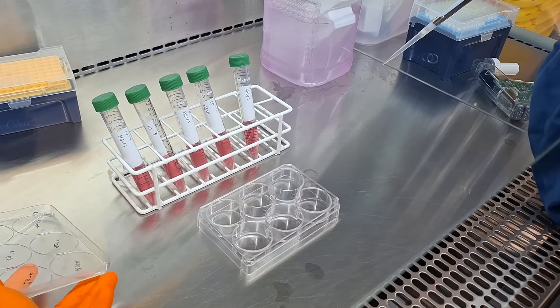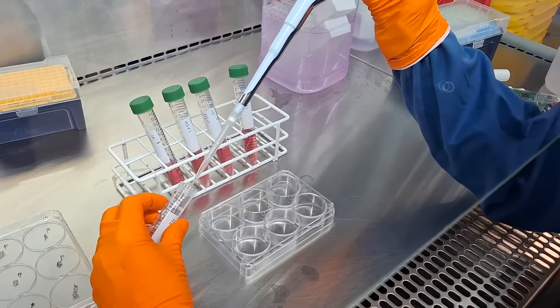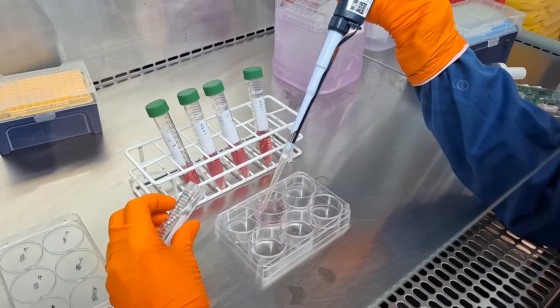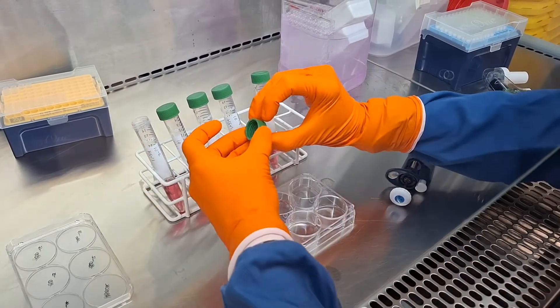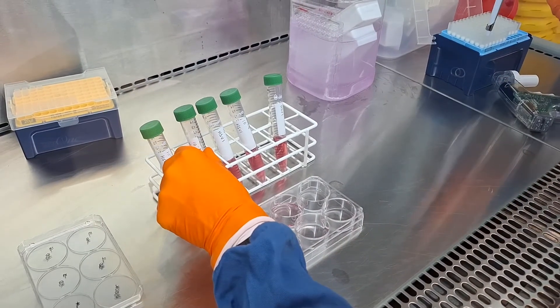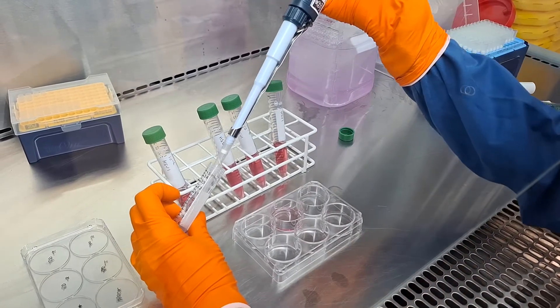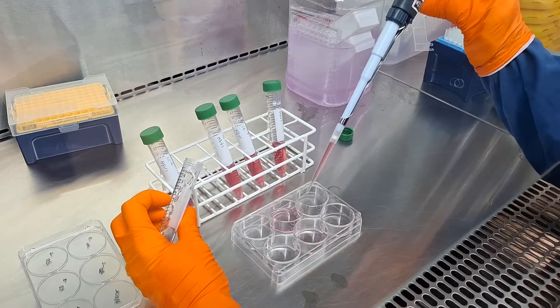Next, the virus sample is diluted serially to create a range of concentrations. Aliquots from each dilution are added to the cell cultures. The goal is to find the optimal dilution where individual plaques can be clearly identified. This step is crucial because too many viruses will overwhelm the cells, while too few may not form visible plaques at all.